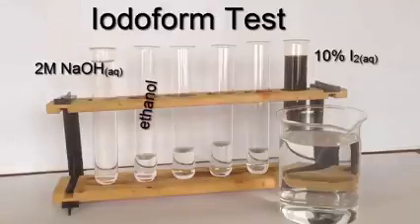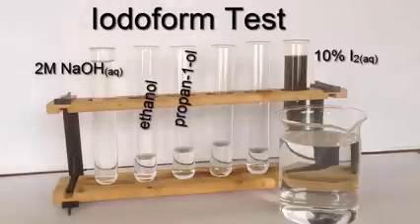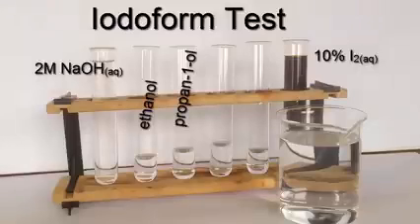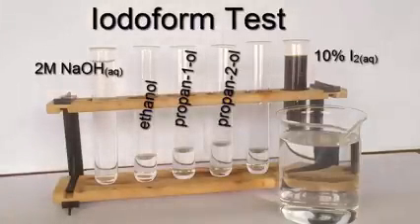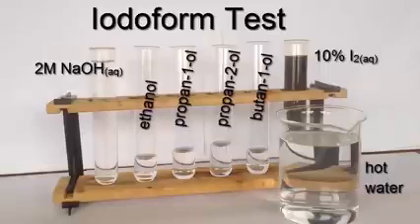In the second test tube, I have ethanol. In the next test tube, I have propan-1-ol. And next to that, I have a position isomer of propan-1-ol, propan-2-ol, and then in the next test tube, butan-1-ol. And you'll see there that I also have a hot water bath.